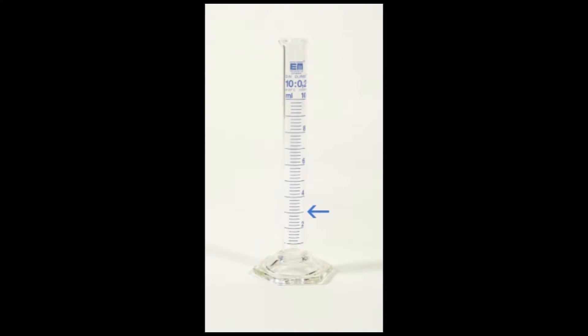Add a known volume of water to the cylinder to an exact milliliter. In this example, we will fill the cylinder to 3 milliliters.